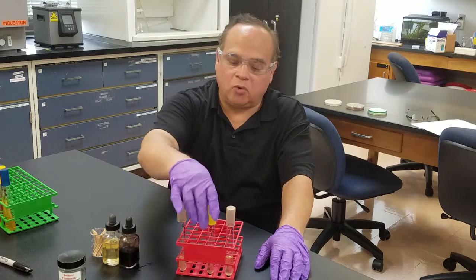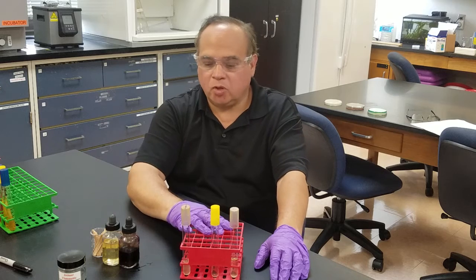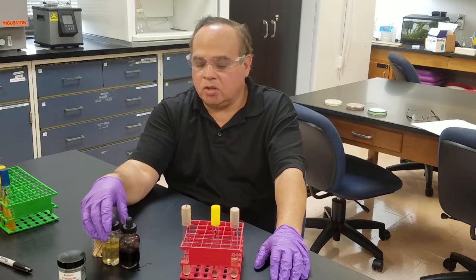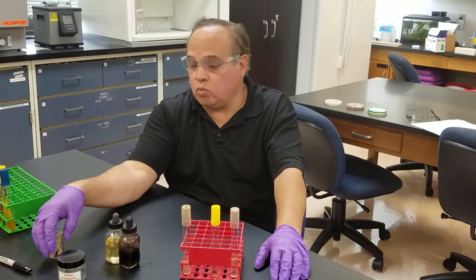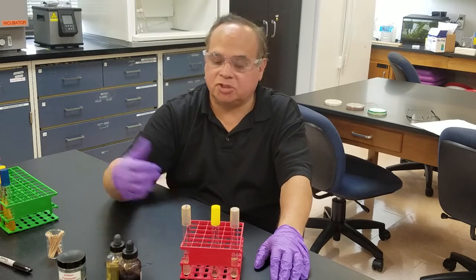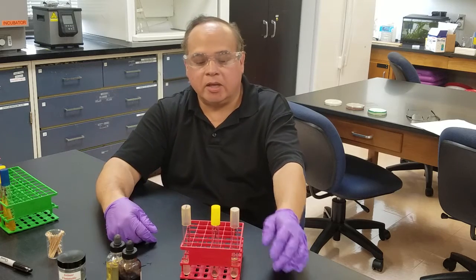Here I have three different organisms and I'm going to add three different reagents to the tubes — two reagents if it's positive for the first step. The first step is looking for nitrate reduced to nitrite.